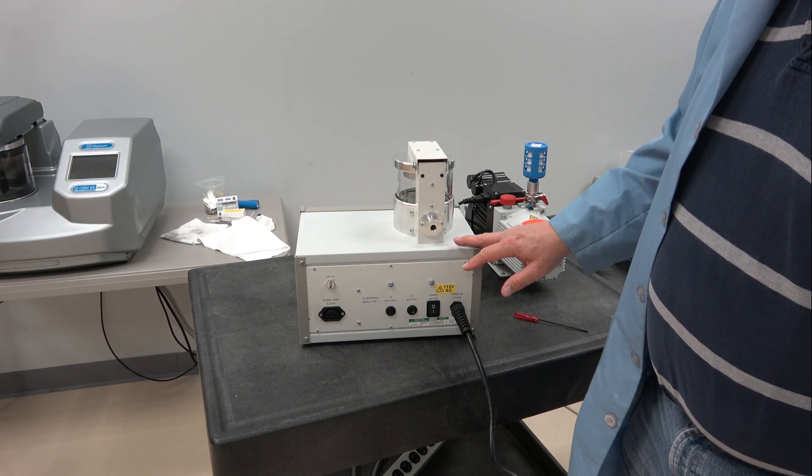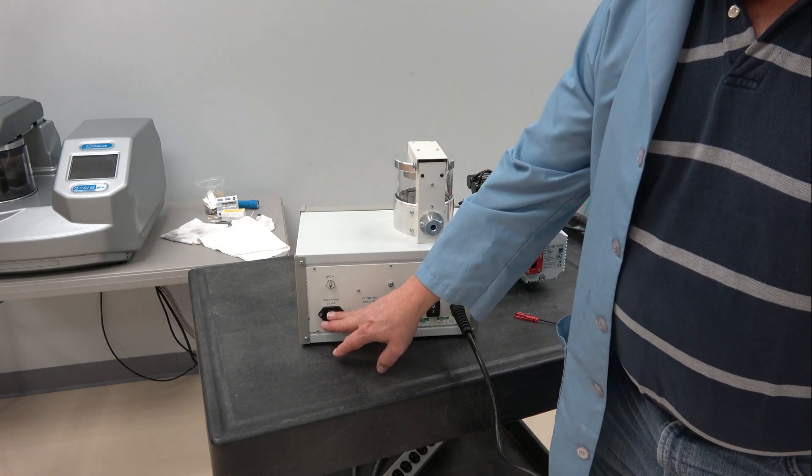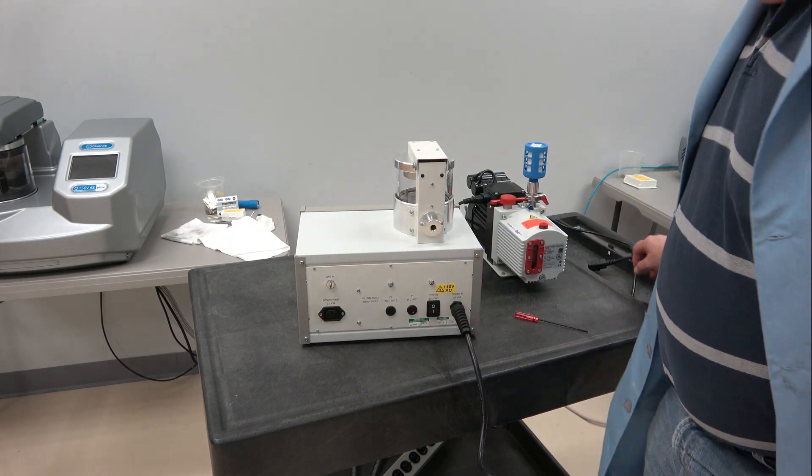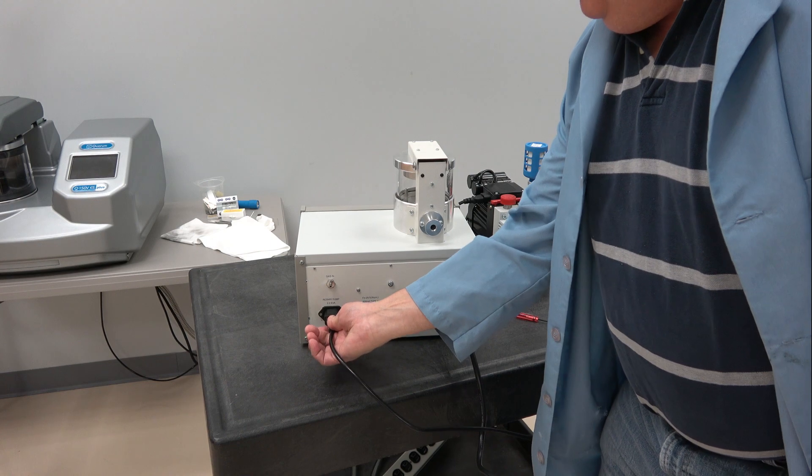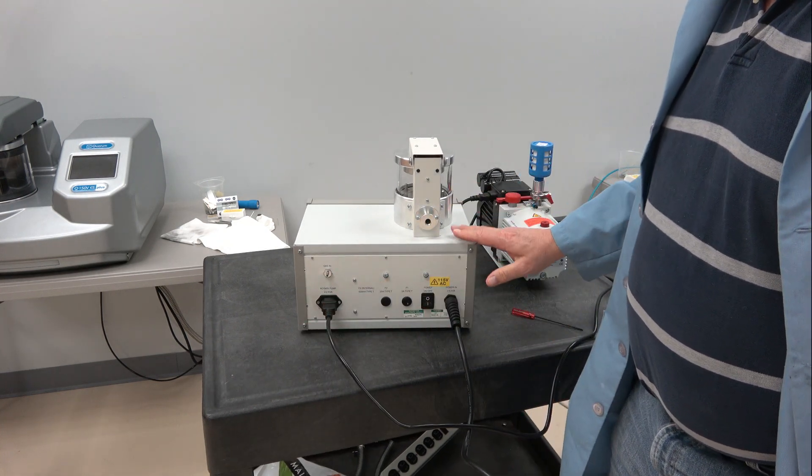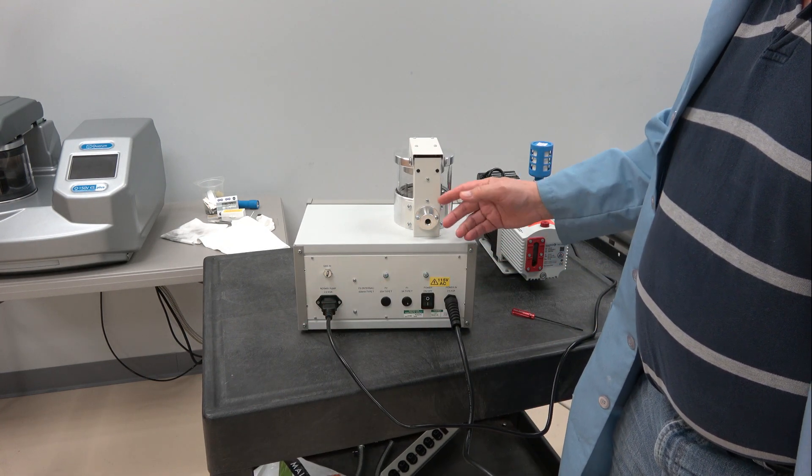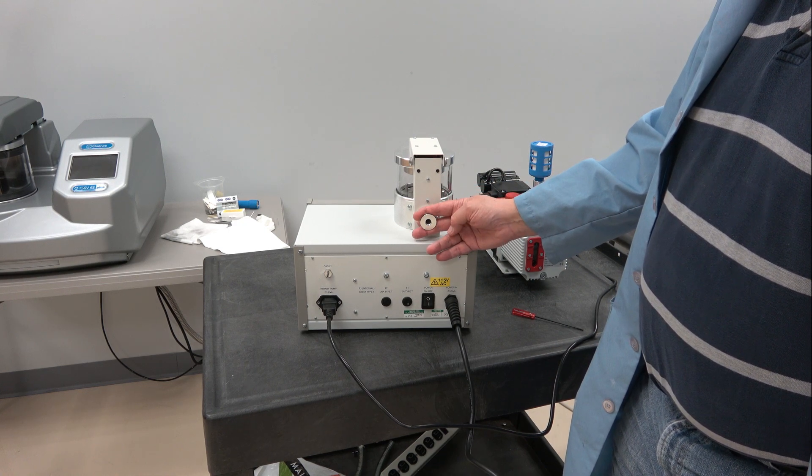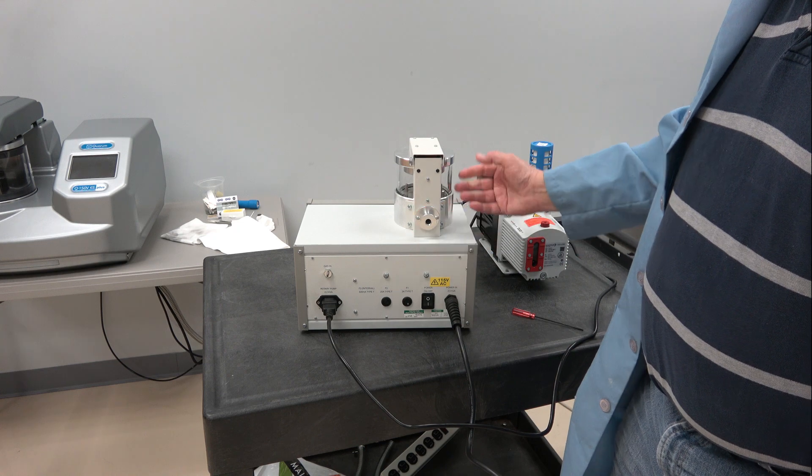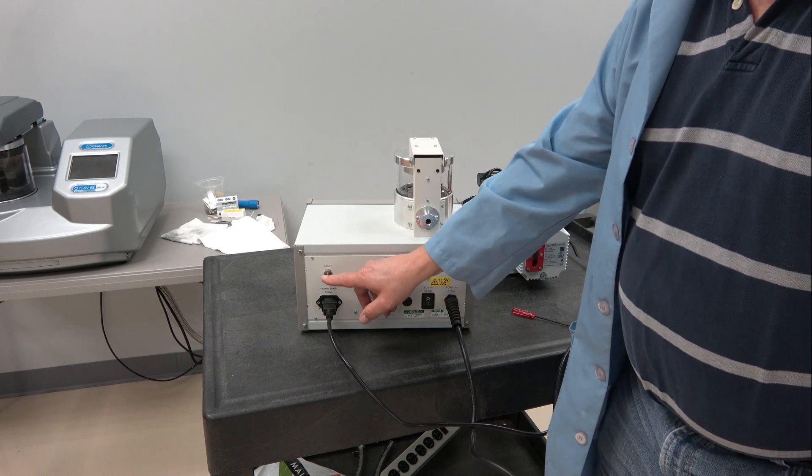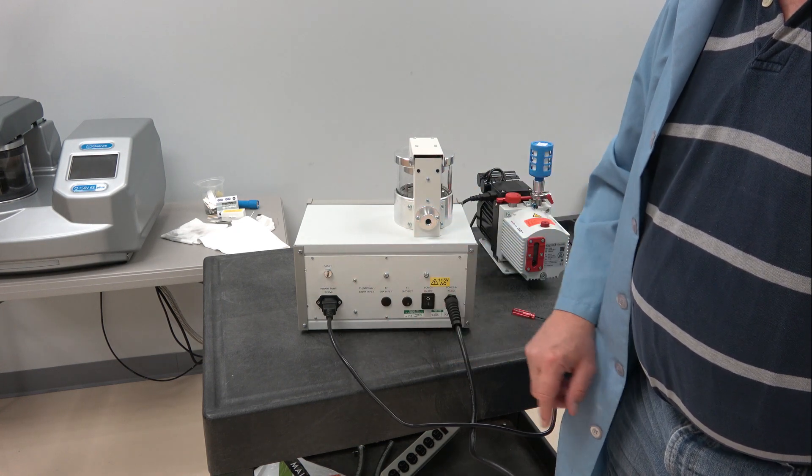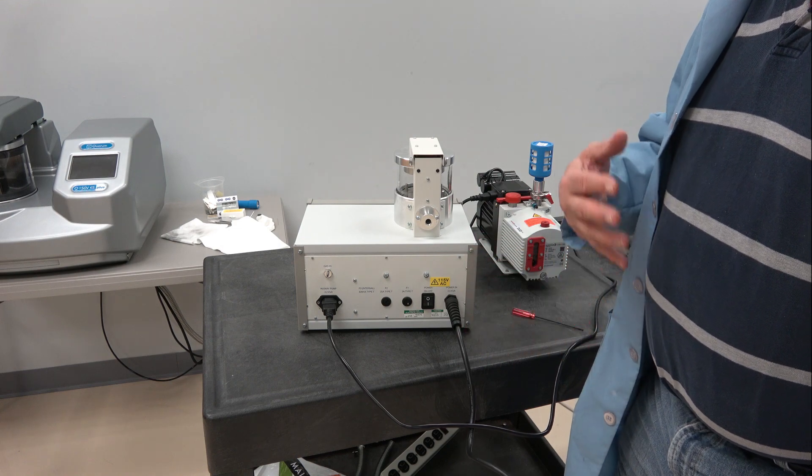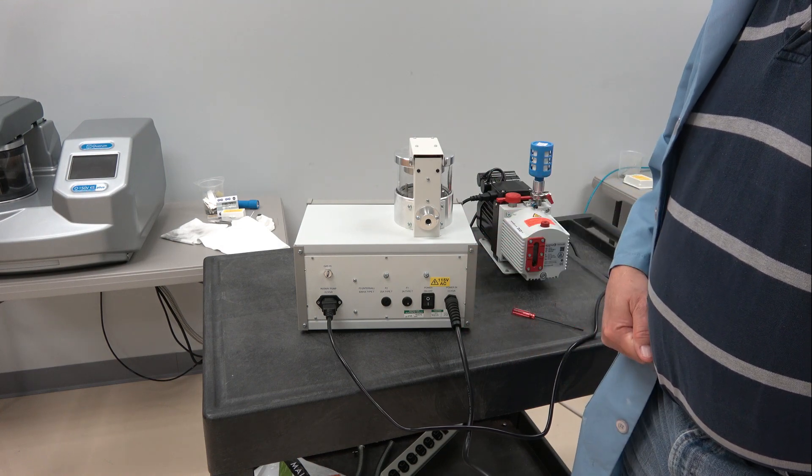We have the output for plugging the rotary pump in so it's connected in sync with the unit. We have the 10KF vacuum fitting on the back of the chamber for pump out, and we have an orifice to introduce argon, which is the carrier gas for the sputter process.